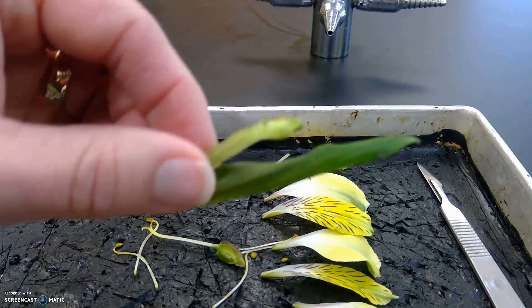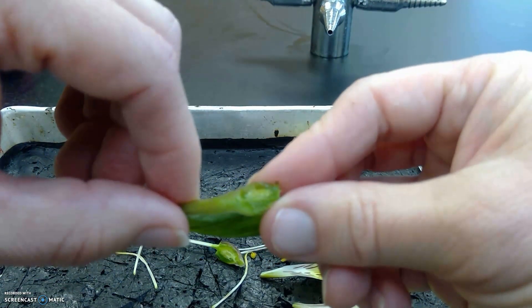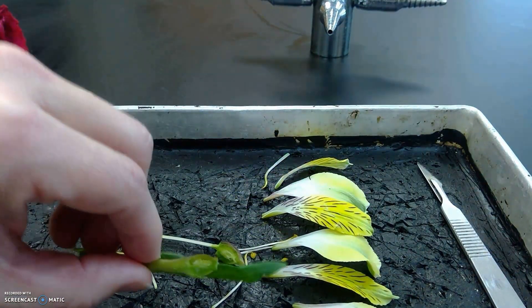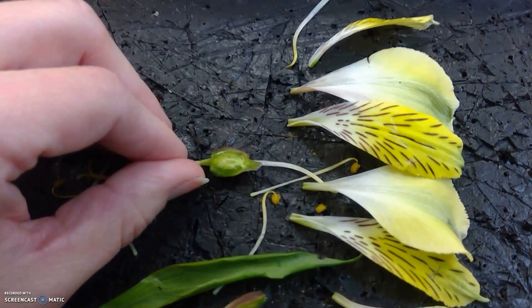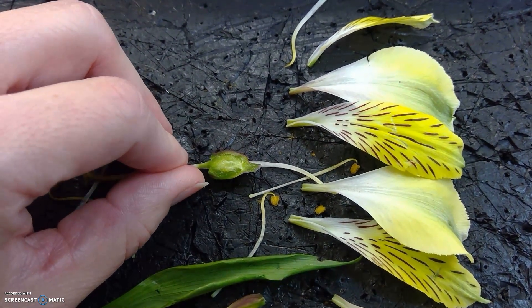I'm going to bring it a little closer. You can see the ovary on the inside. That's where the ovules are, and it's kind of two halves to this ovary. Maybe if I tilt inward you can see a little bit better. And that is the monocot.